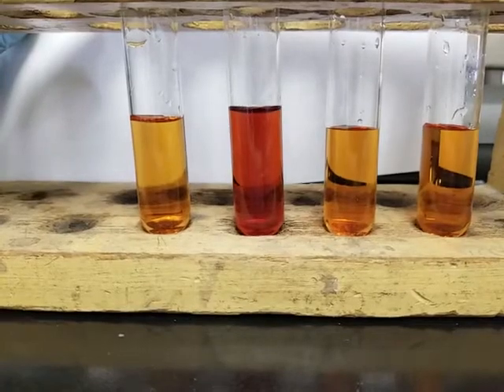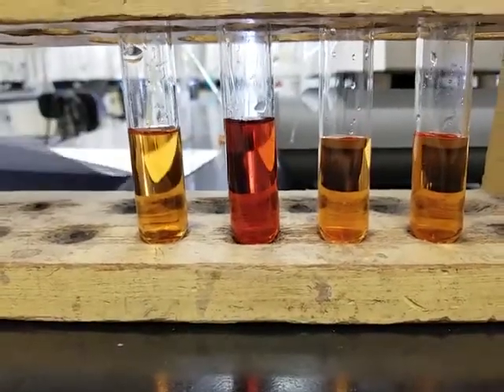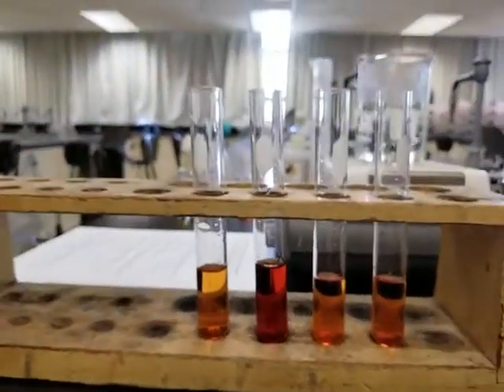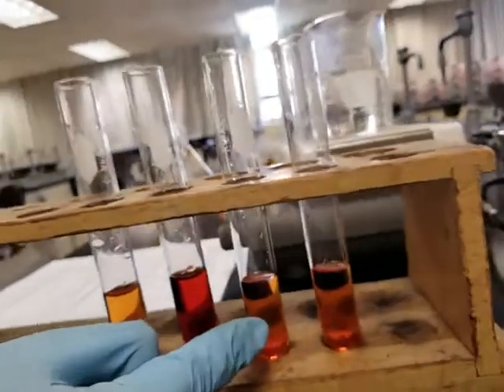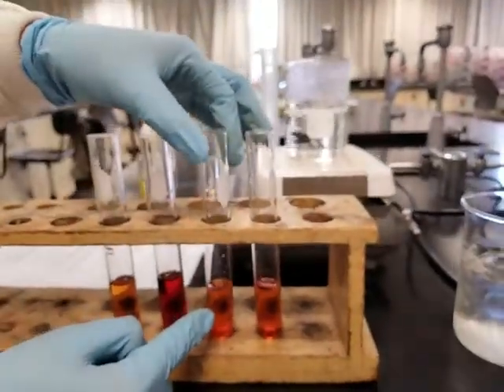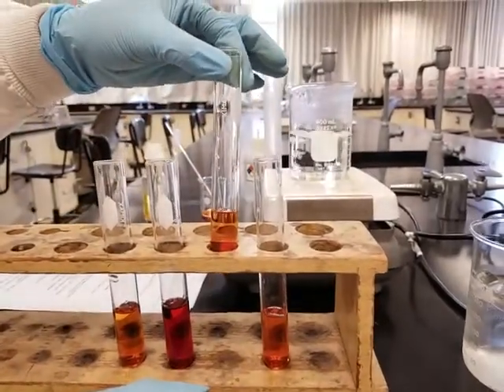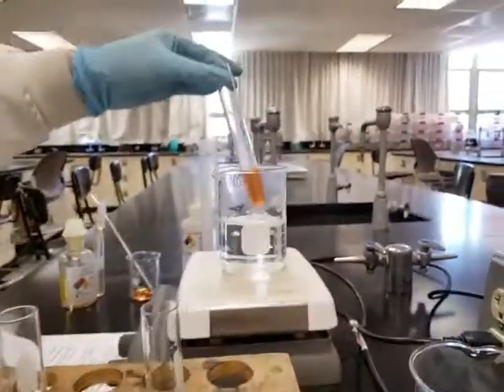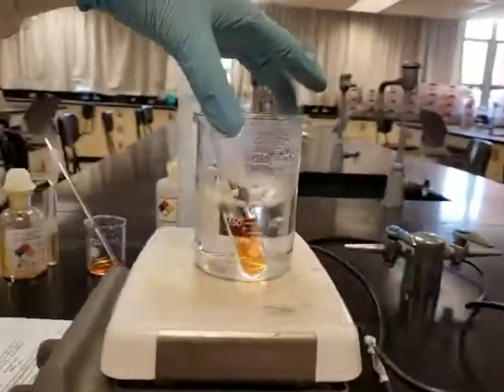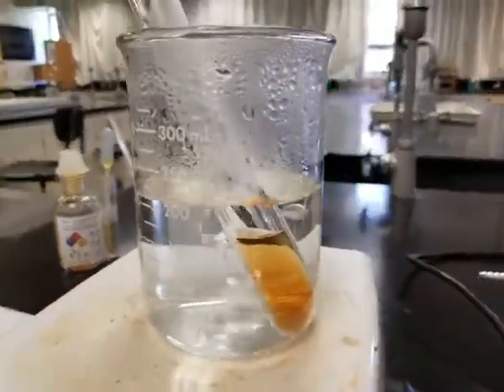Now let's go to the next step. Step 3 says, using a test tube holder, place the 3rd tube, this is the 3rd tube, into boiling water until you observe a color change. So let's go ahead and do that. Since the tubes we're using for demos are larger tubes, it's pretty fine. It's not going to topple over, so we can just place it directly and see if you see any changes. Let's remove the label a bit from the side.